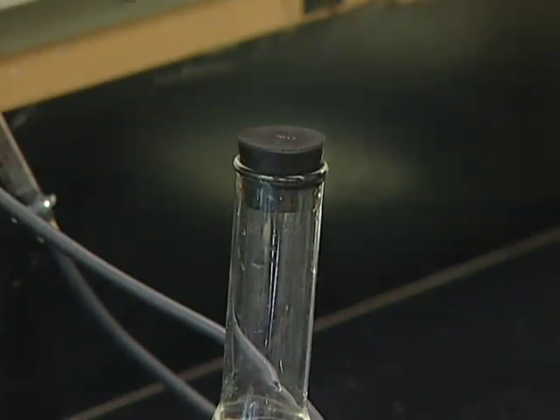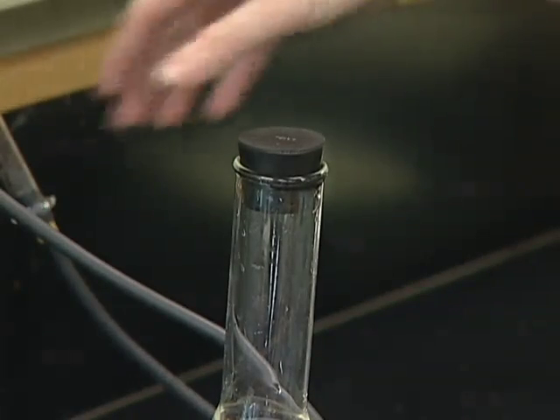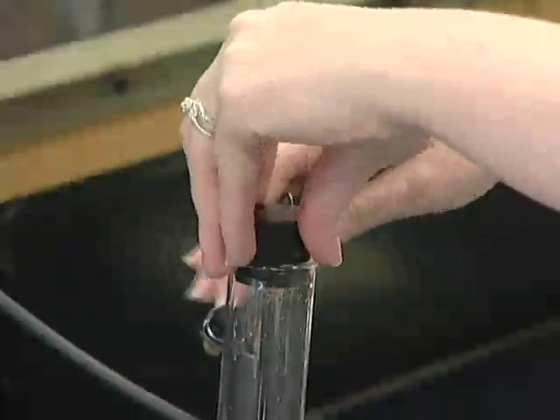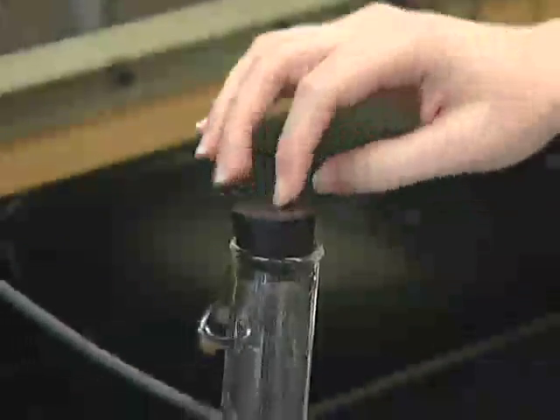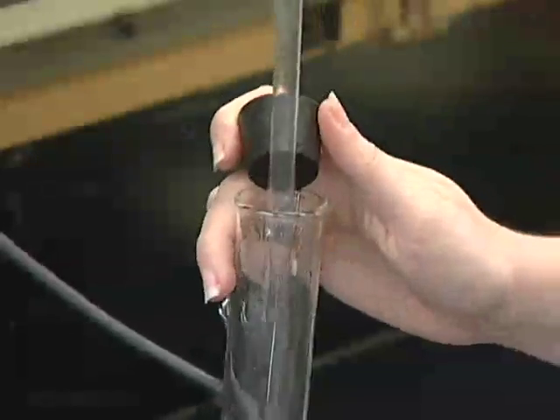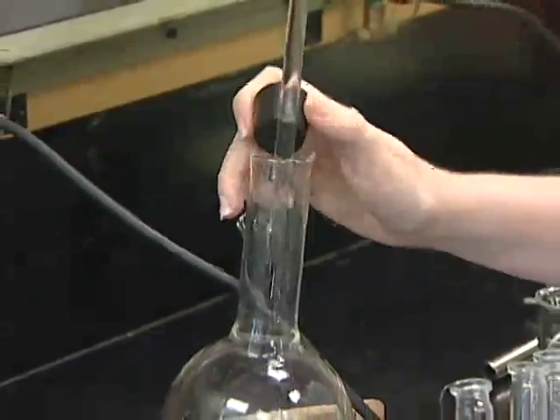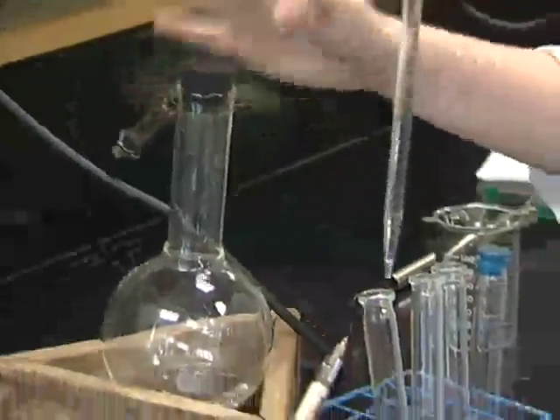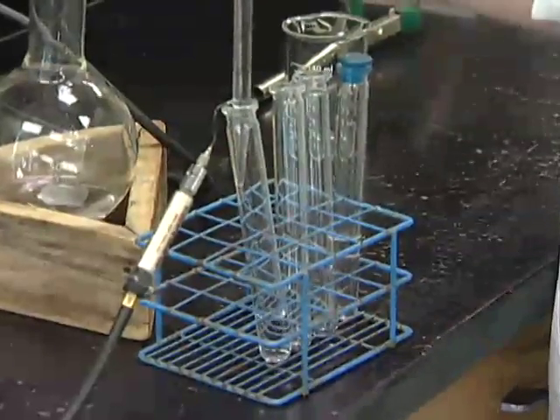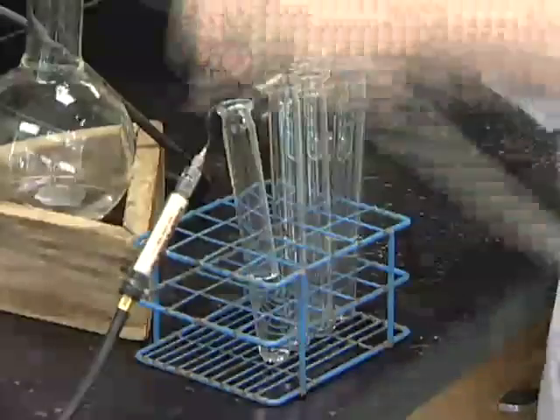Much like making media, we're going to dispense this in a similar fashion. We'll want to try and keep this capped at all times, so stick your gassing probe back in and try and keep the cap on. And you'll grab your pipetter and go ahead and put the cap back on and dispense into the tube, and you want to have your stopper ready so you can immediately close this up.